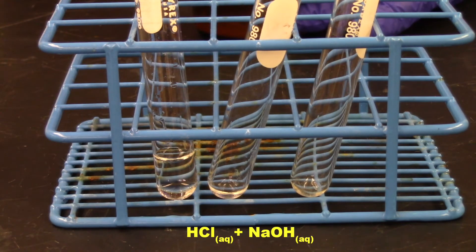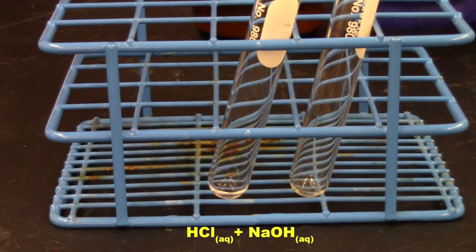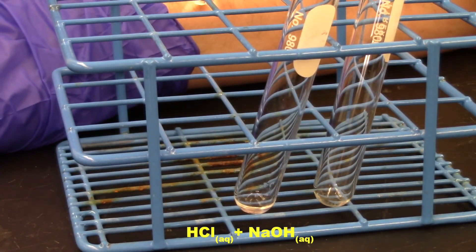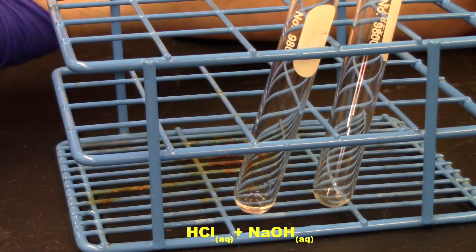Now this is a common acid-base reaction. And let's see what happens. Add them together. Mix, mix, mix. Now I'm going to take the palm of my hand, or the skin, and I'm going to press the test tube against it. Let me pull my glove down just a little bit. So this is my bare skin.